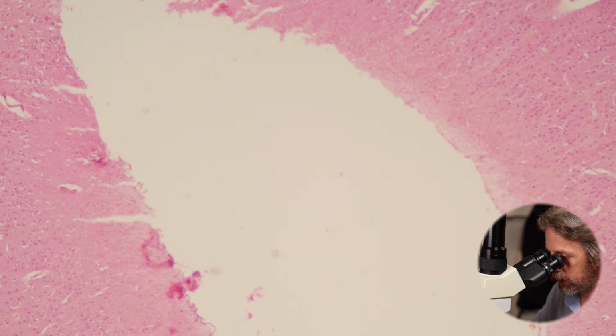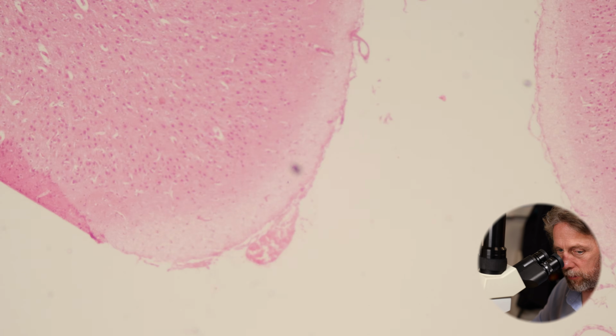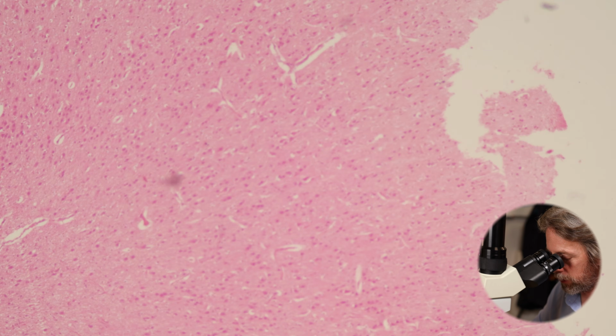And like I say, that section is from 1937 that was made. And yeah, gyrus, sulcus. It still works. It's probably in exactly the same condition as when it was first made, and I'll put it back into its box. But I have got another slide for you.